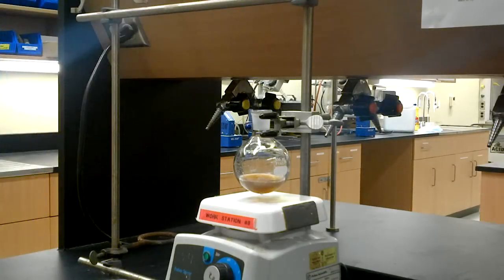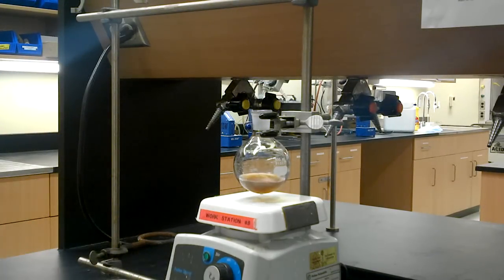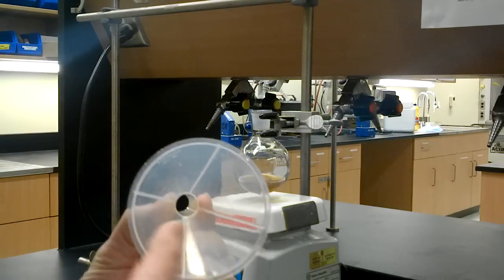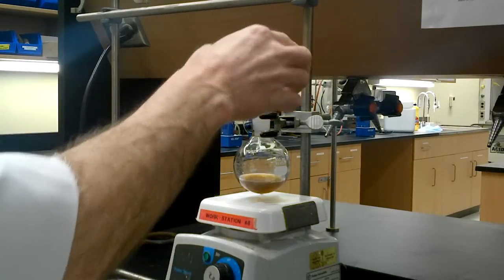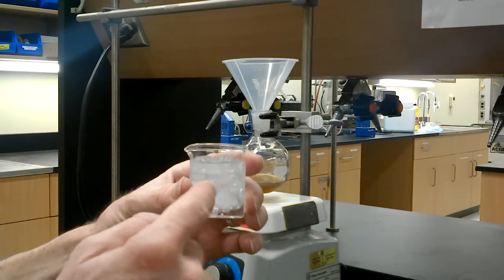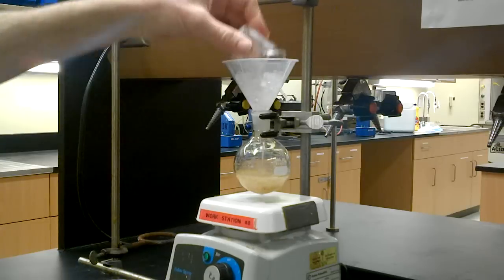Now, we've cleaned up. Everything's been stirring away. It's warmed up to room temperature, and now it's time for the quenching. The powder funnel, the one with the big hole, is used. We'll just add 50 milliliters of ice water, mostly ice, and we just add that in there.